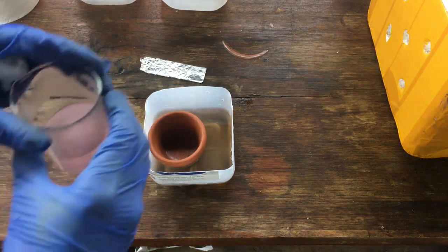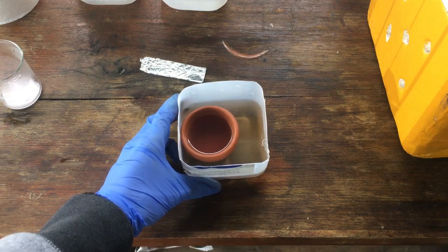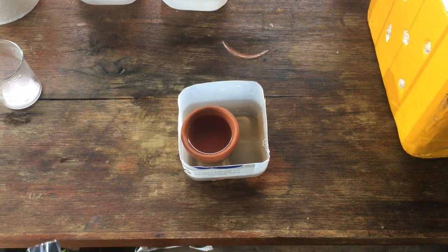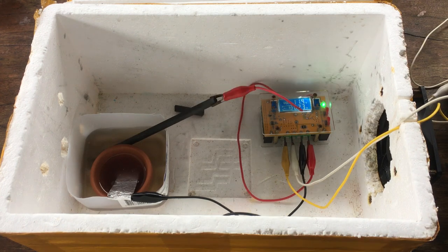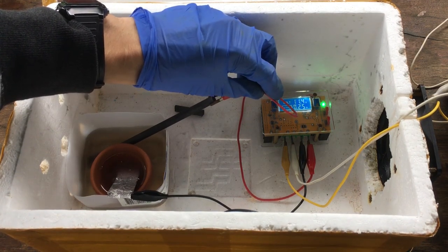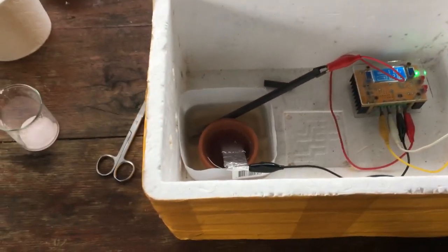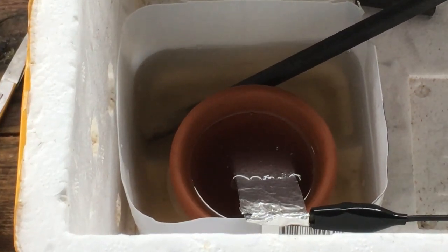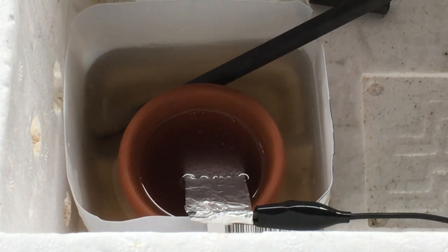Just adding the manganese solution to the cell — you can see here the nice pink colour of our manganese sulfate. Now if we go ahead and connect up our electrodes, we should be ready to go for plating out our manganese. Turning on the cell and turning up the voltage lets us put a little more current through. We're getting about a quarter of an amp at 11.4 volts. Sadly, it doesn't look like we're generating any manganese metal on the cathode yet — it seems to be just generating hydrogen gas — but we'll continue to watch over the next while and see if we manage to get any manganese metal plating.